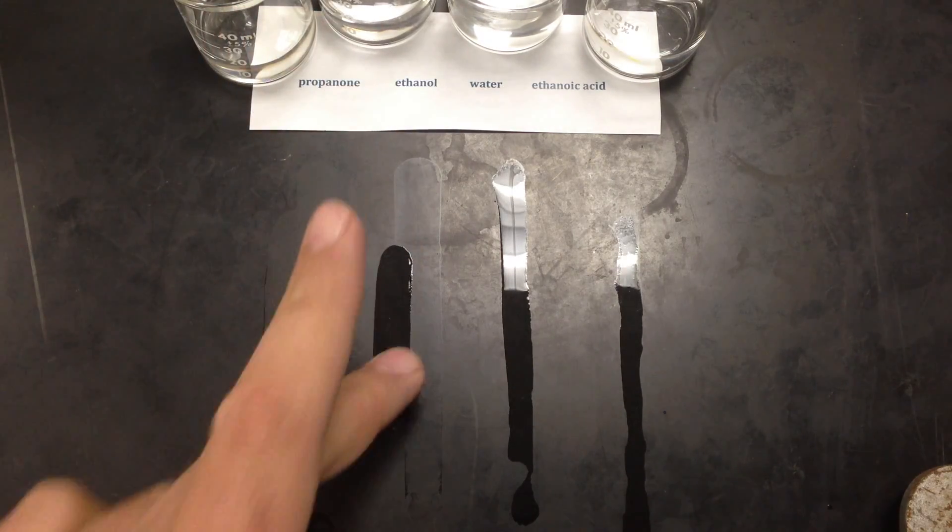It's going to take a little longer, but is that beading up compared to the water? No, because it doesn't attract each other that strongly. But the water and ethanoic acid are still holding strong because of their higher attractive forces.